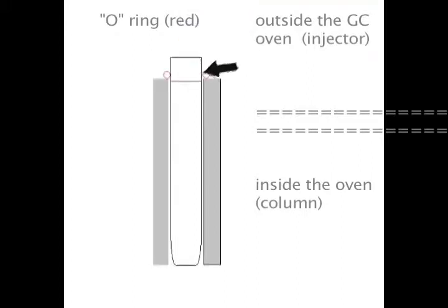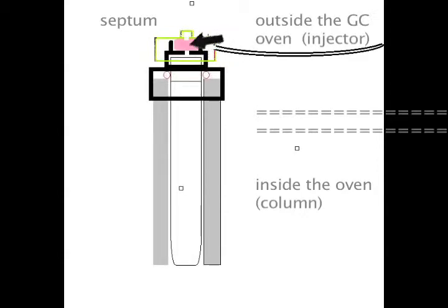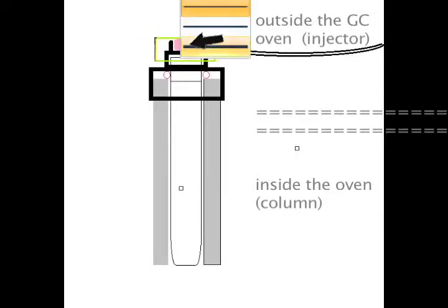The sleeve accepts a nut both on the top and on the bottom. Let's look at the top first. The top has an o-ring. The o-ring is squeezed down by a nut, and so the o-ring forms the seal between the sleeve and the port liner. This nut also has a little place that accepts the septum, and then another nut that goes on top and holds the septum in place. So the needle goes through the top nut, through the septum, through the bottom nut. The whole system is pressurized from the top and sealed with the o-ring.